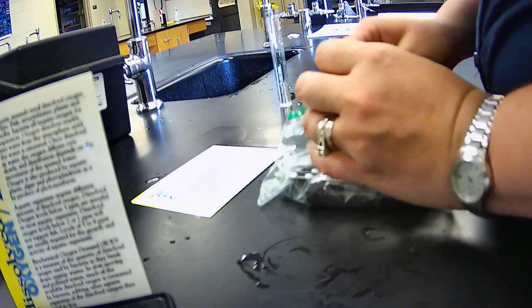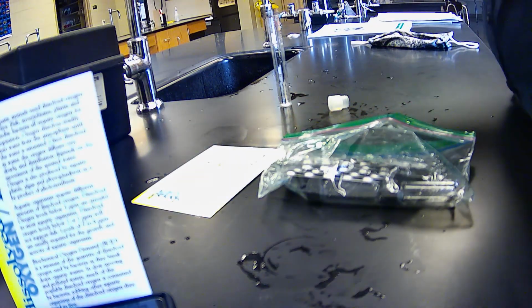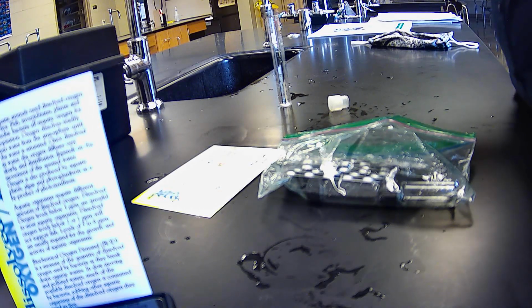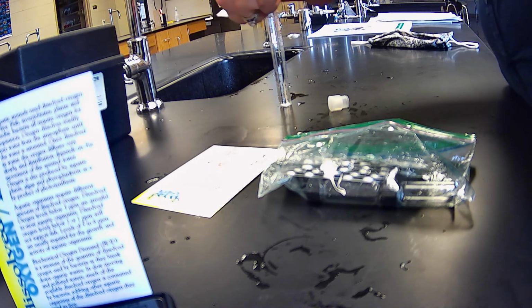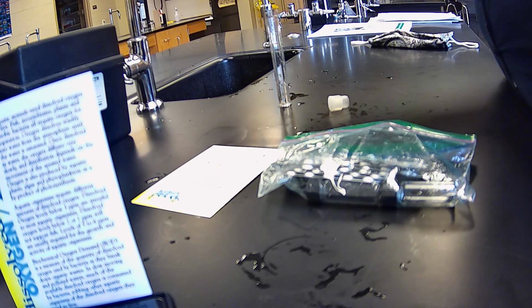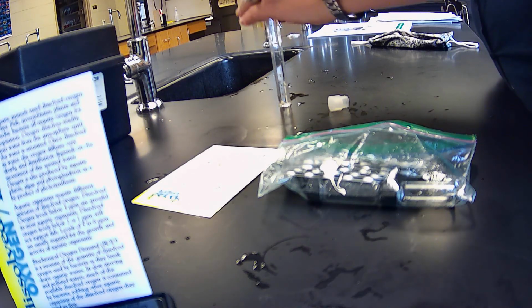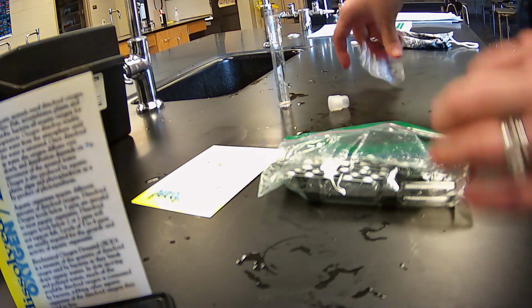All right, so we filled it overflowing, and we're going to take 2 of the dissolved oxygen tabs and put them in there. I always like to do the tabs right over the sample place, because they tend to break up on you, like that one did. That way, first off, it helps them disintegrate faster, but also you're not losing any money from your tab not being right. There we go.